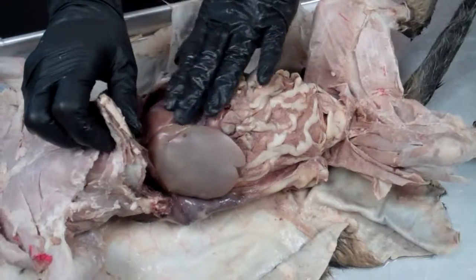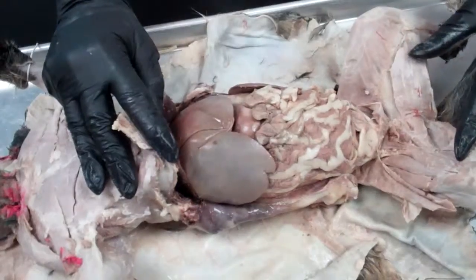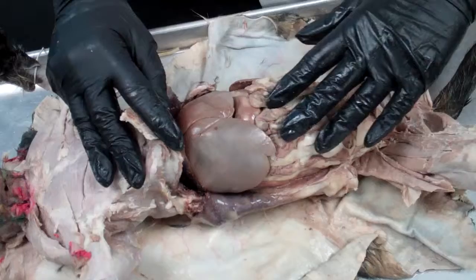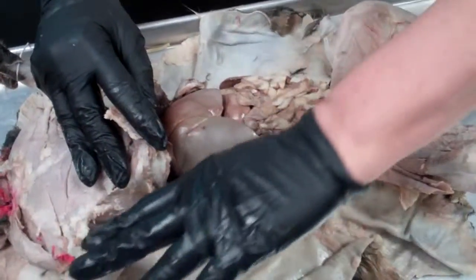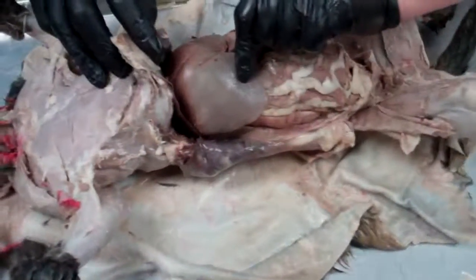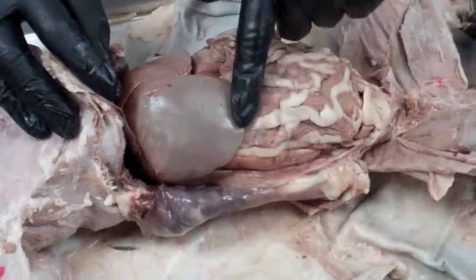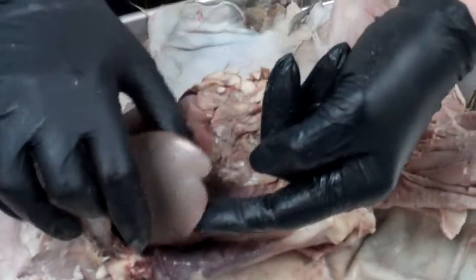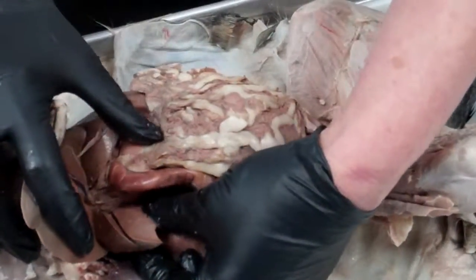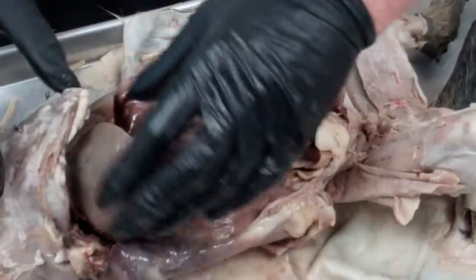One of the first things that we're going to see is the liver. Okay, the liver is a very large structure, the largest organ in the body if we don't include the skin. And the liver is divided into a left and a right side. So this is the right side of the cat. So this is the right lobe of the liver. Okay, and this is the right medial lobe, this very large lobe here. And then if we lift that up and look toward the side, we'll see this two-part lobe here, which is the right lateral lobe of the liver.